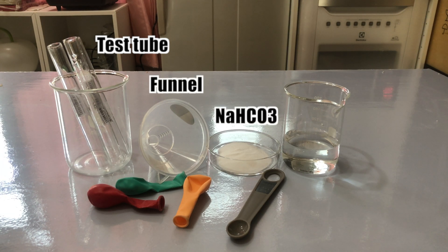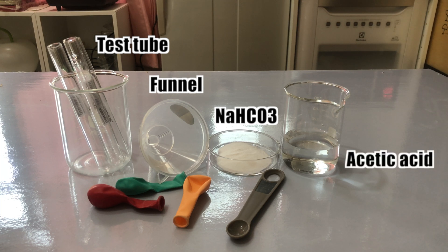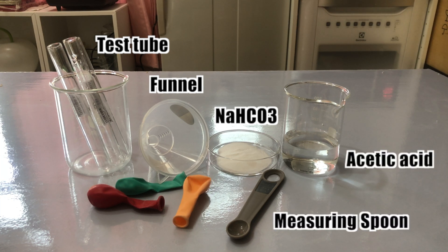funnels, sodium bicarbonate, acetic acid, measuring spoon, and balloons.